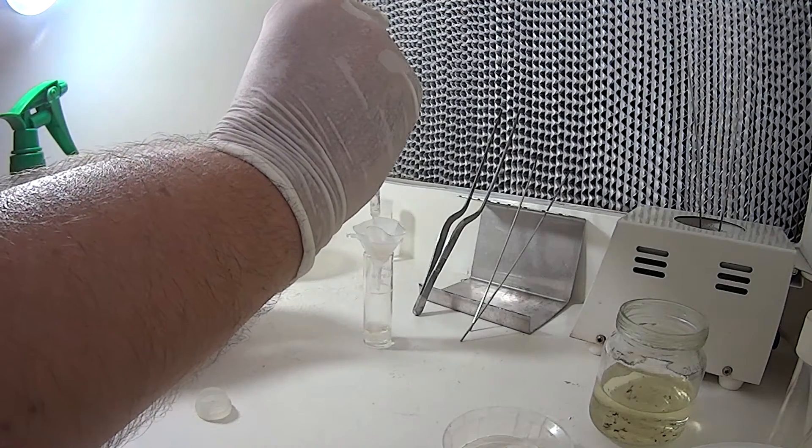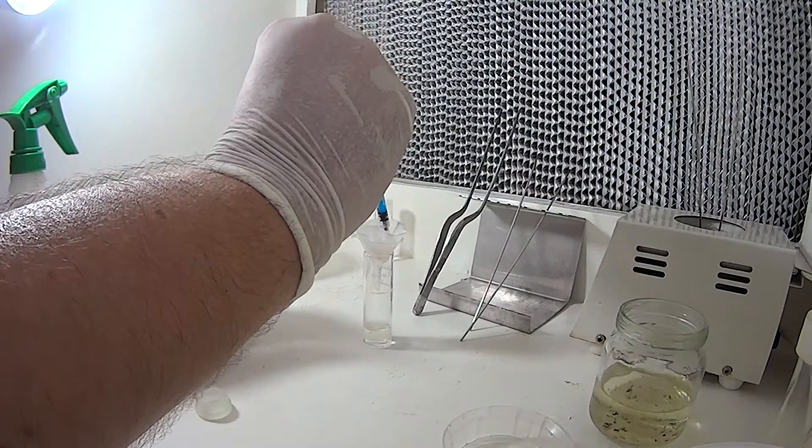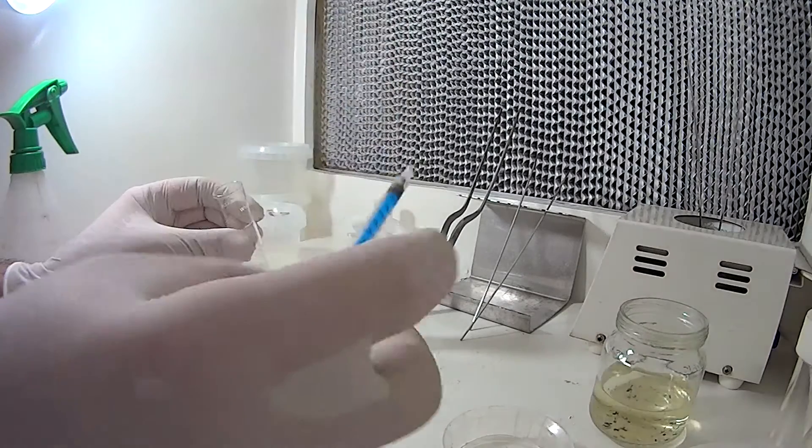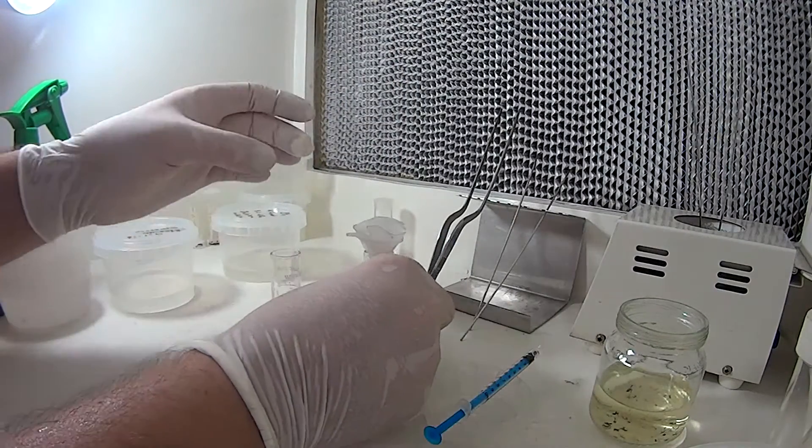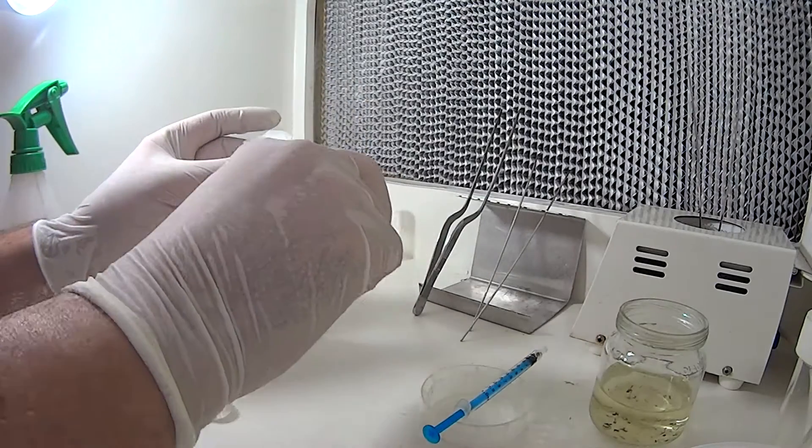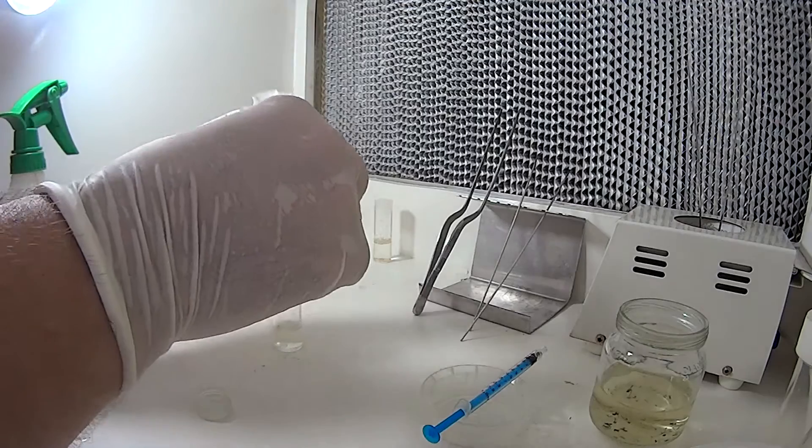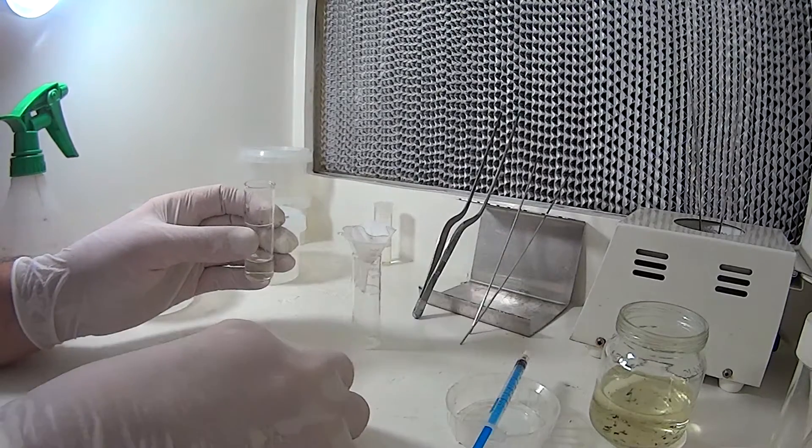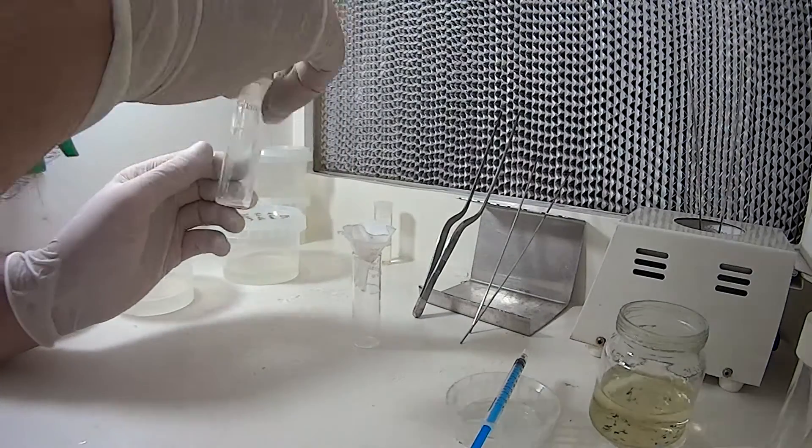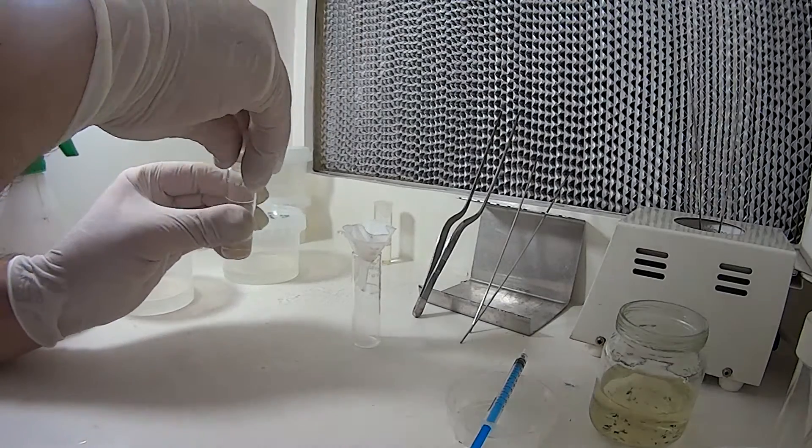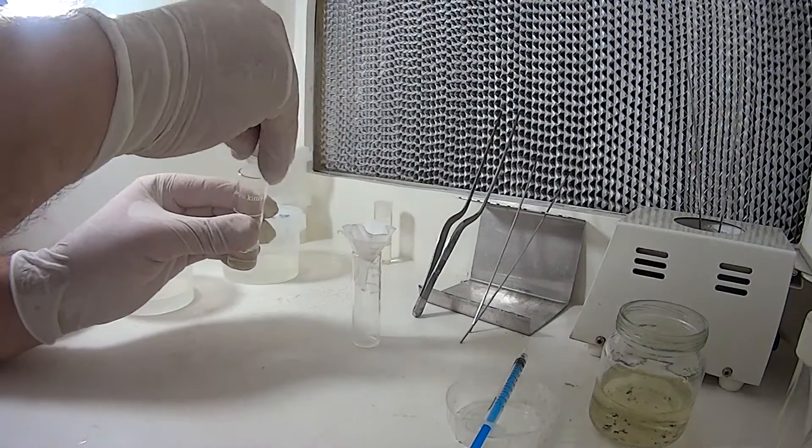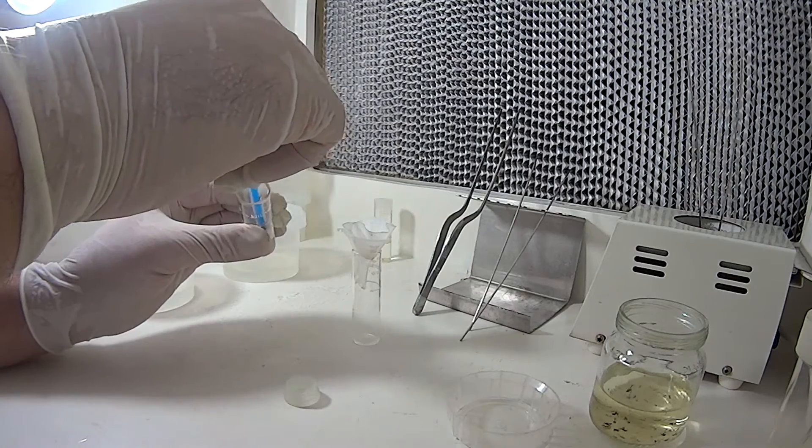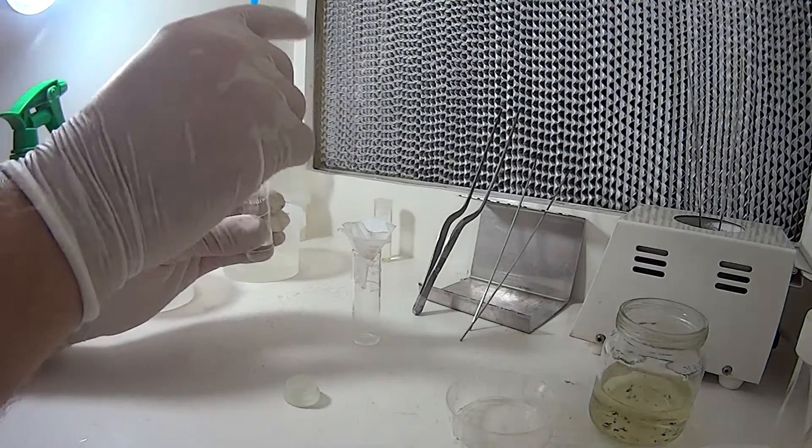So just give it a little rinse and then you might be able to get a few more seed. So what I mean by that is, what I'll do is take this filtered sterilization solution, pour it back in, grab a few more seeds in, shake it around. Hopefully we can get most of it, there's quite a lot of seed in here, so if you don't get it all, that's no major problem.